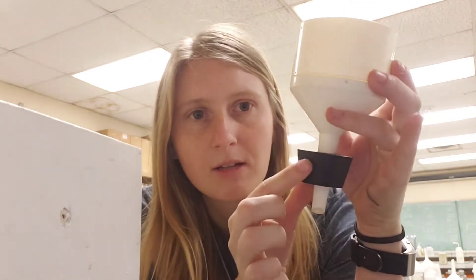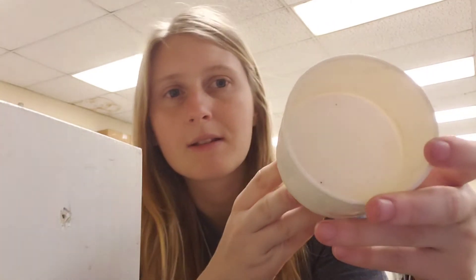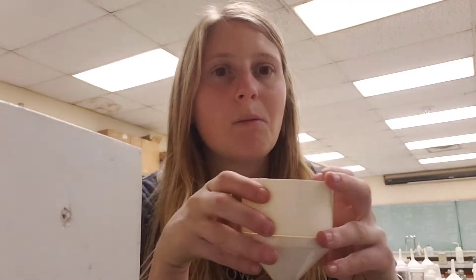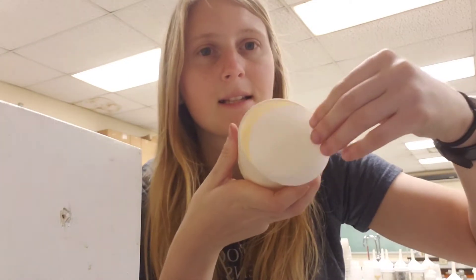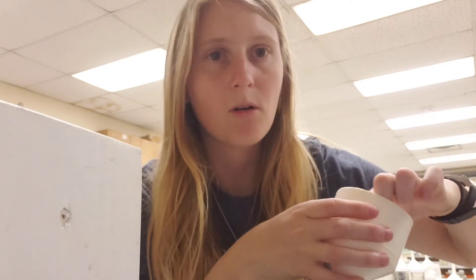Now we're going to prep our filter portion. What you have here is a funnel with a stopper so that you can apply enough pressure through the machine. There are holes on top so that water can leak down through the funnel. To keep the soil from going through those holes, we use special little filters that fit perfectly inside — you just push it down and run your finger around to make sure there are no gaps. And that's prepped.